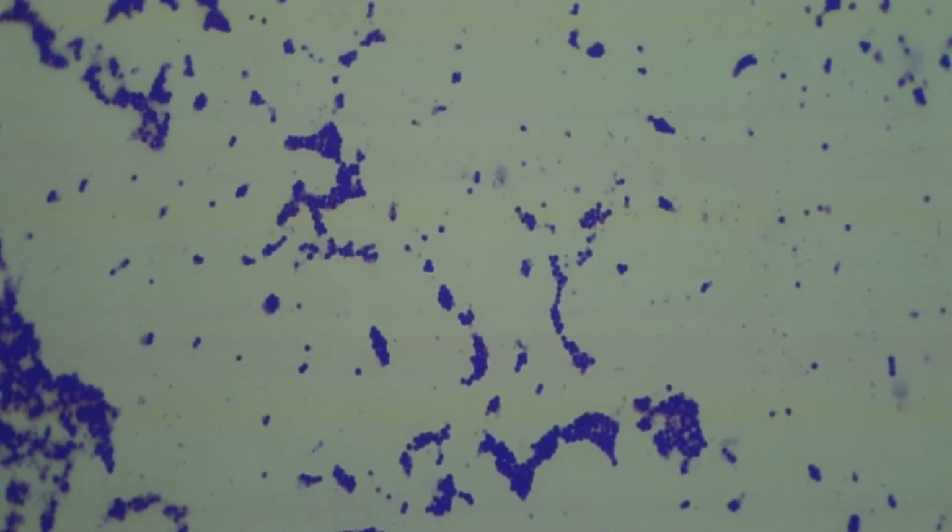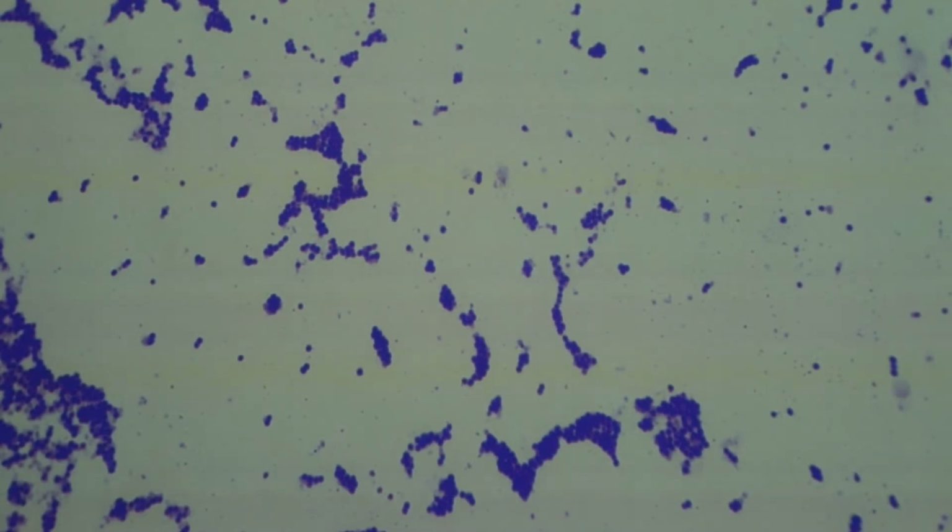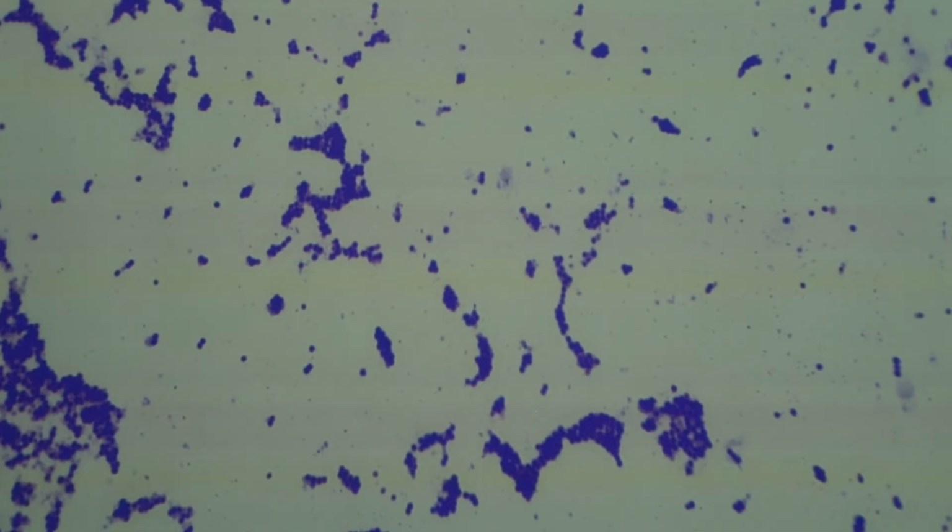First of all, did crystal violet help us see Staph aureus under the microscope? I would say yes. We have this tremendously white background and now we have dark purple cells. So we can see that the shape is a coccus. We can see some arrangements here that are grape-like in their clustering. Let's compare this on the same slide, and for this I just need to slide over to this region.